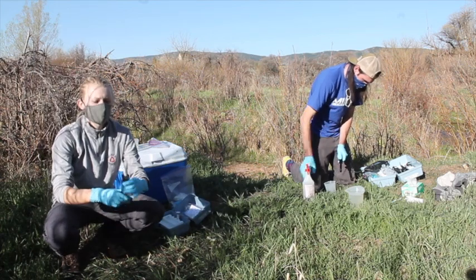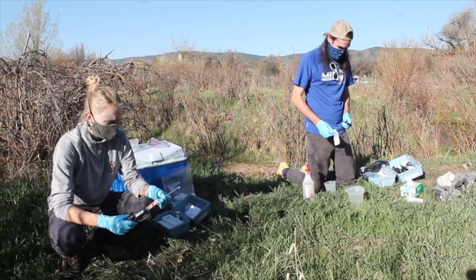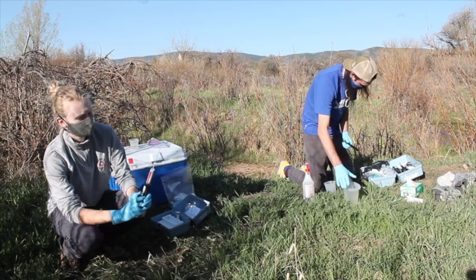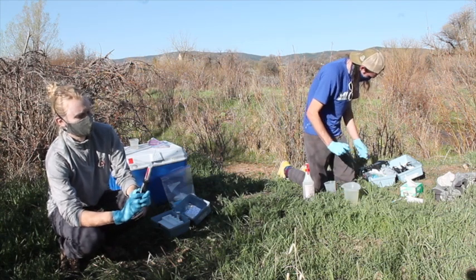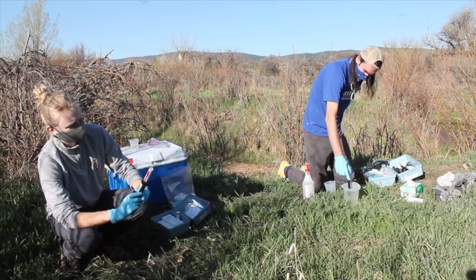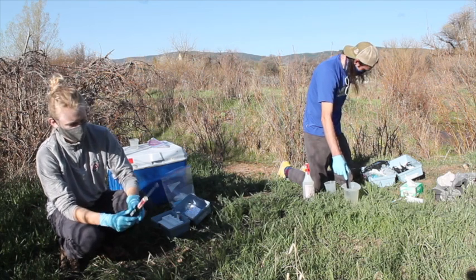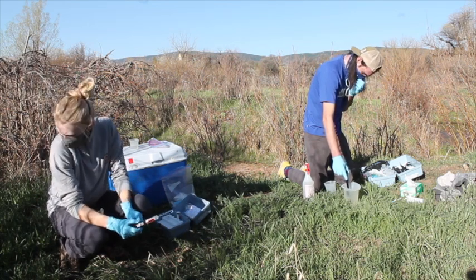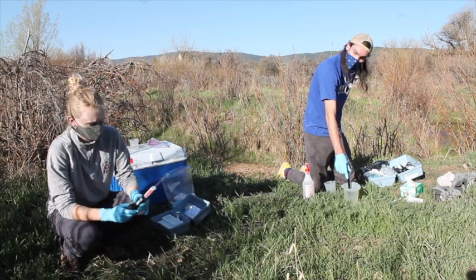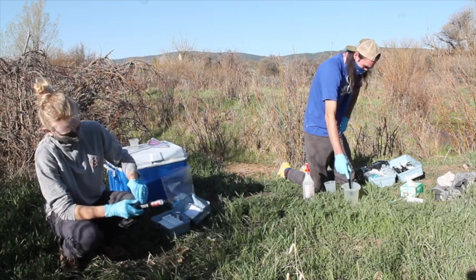This is always the hardest part — I'm going to try to get the air bubbles out without spraying acid all over Sam. The burette hook seems kind of wonky but it works. Now I'm doing conductivity: calibration is done and I'm just going to do three trials so we have three data points. Always good for triplicates — you never know.